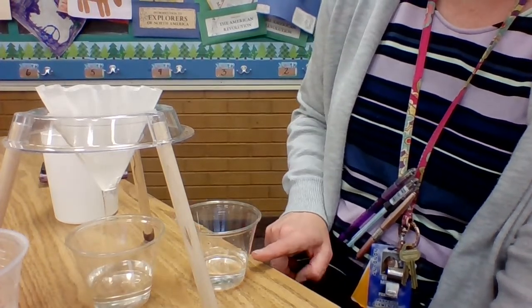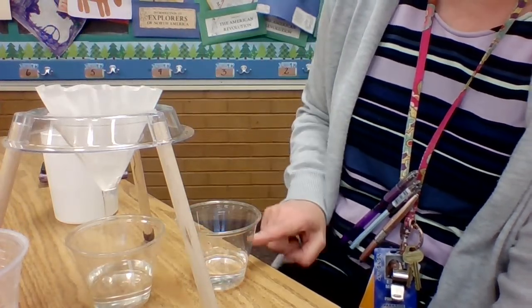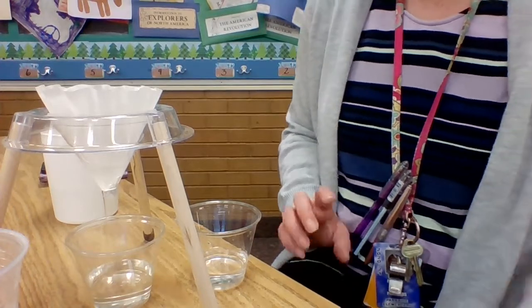It's not quite clear. It looks a little yellowish to me. And we can also see that the water level, even though I've still got some water coming out here, the water level in this cup is already higher than the water level in this cup. And again, that's not surprising because we did add things to the one that's being filtered. So we would expect that because we added more to it, there would be more coming out, right? Matter does not just disappear into thin air. Even though we can no longer see the solute, this is one way that we can show that the solute is still in there because the water level changed. And that wouldn't happen if the solute just vanished into thin air.